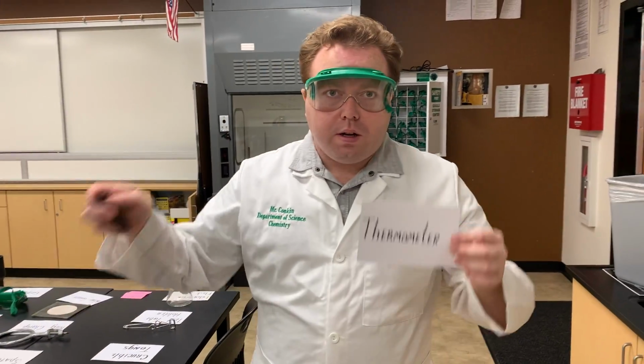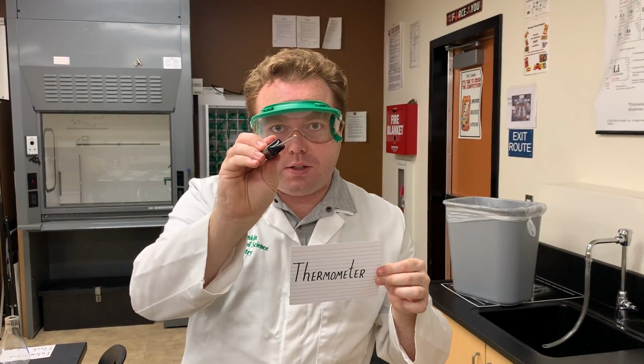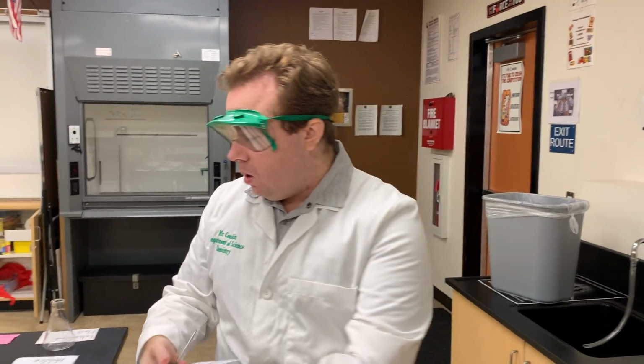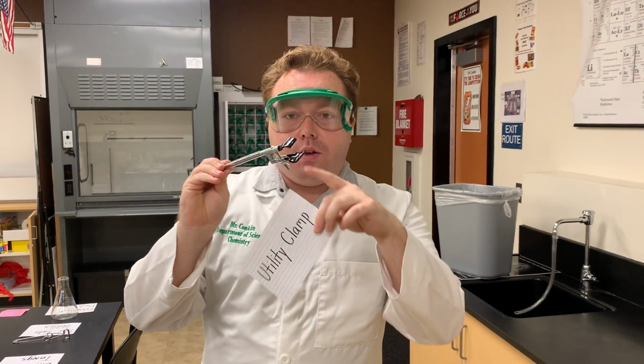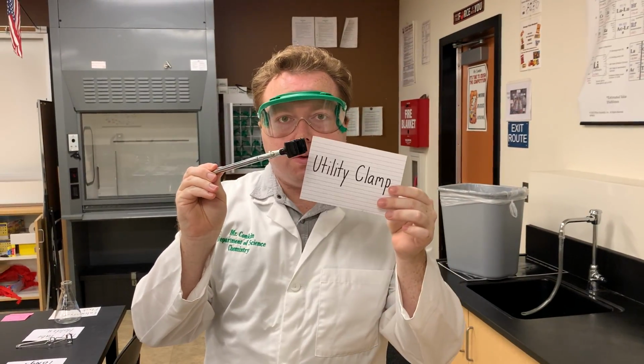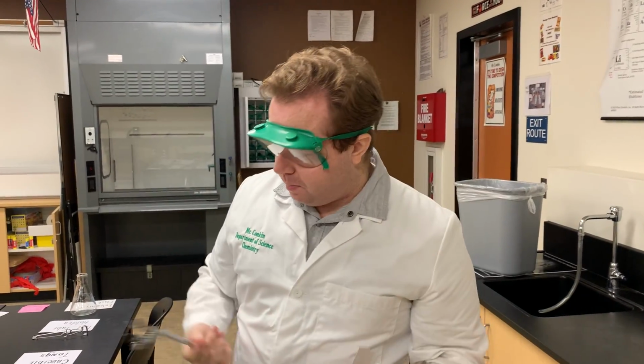The thermometer. We use this when we want to take the temperature of things in degrees Celsius, no F word. The utility clamp is what we use to hold test tubes over a flame. You can see the little hands right here squeeze onto the test tube, and this will get inserted onto the ring stand.